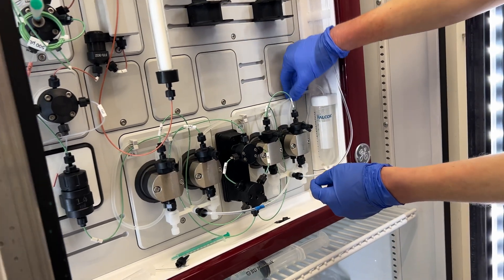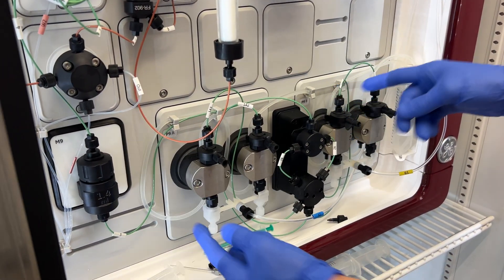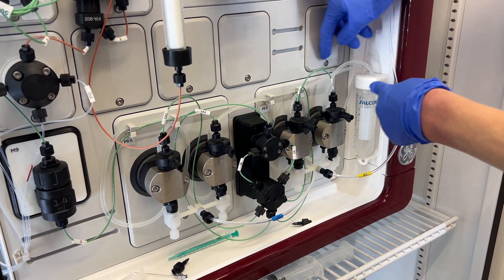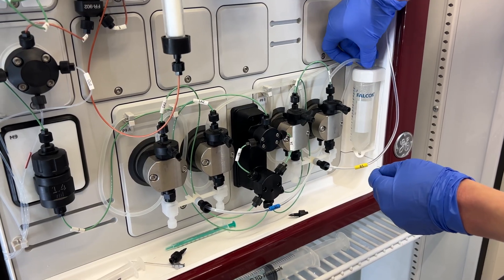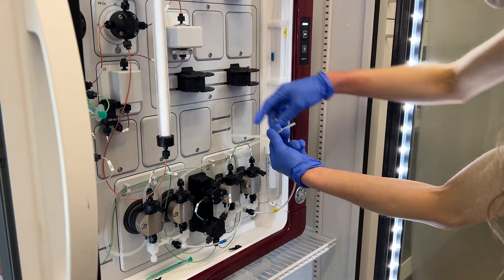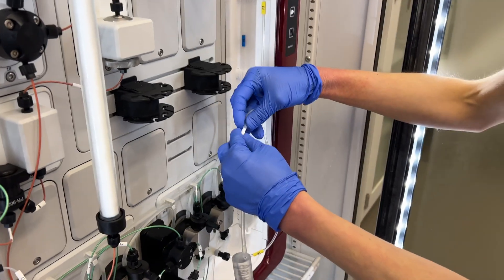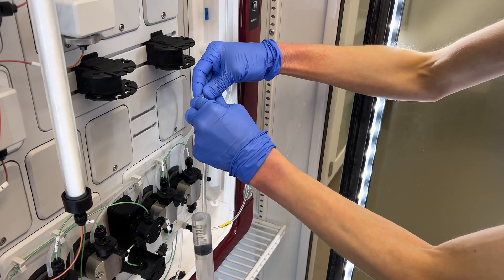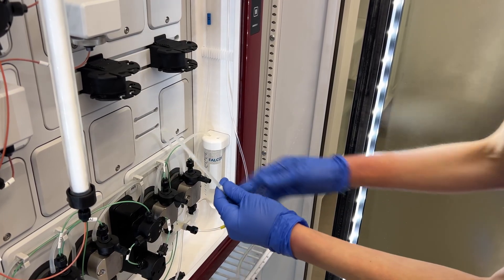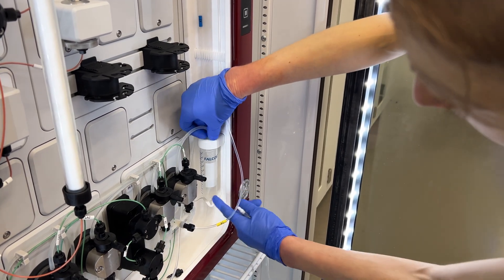The lines go into these tubes via more rubbery tubing that runs to the back of the pumps. It's okay if there are a couple of bubbles in there, but you don't want a lot of bubbles. If there are many bubbles, it might be that the tubing in the 20% ethanol tube isn't all the way down. If it's not all the way down, you'll get air in there. You may need to come in with the tube attached to your syringe and pull liquid through to get that air out, and make sure the lines are all the way down.